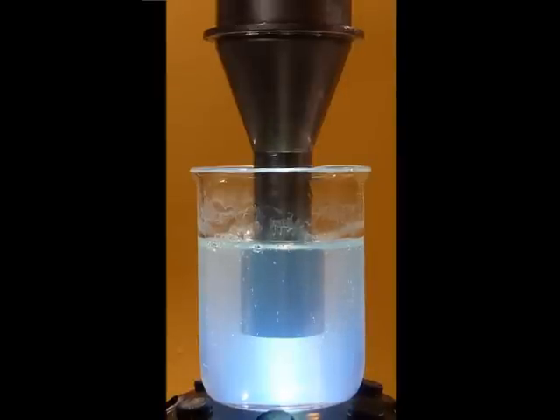You can see that the mixture became completely clear. This signifies that the droplet size is approximately 50 nanometers in diameter.